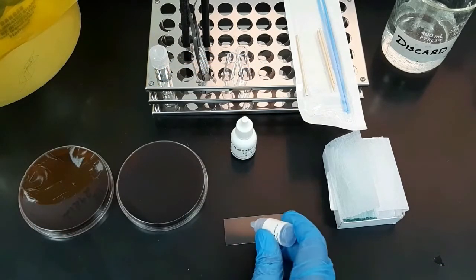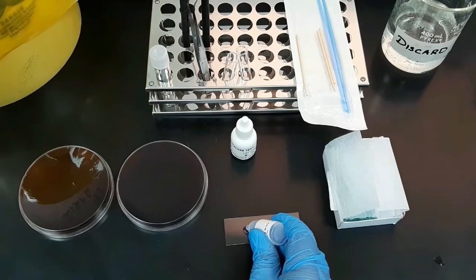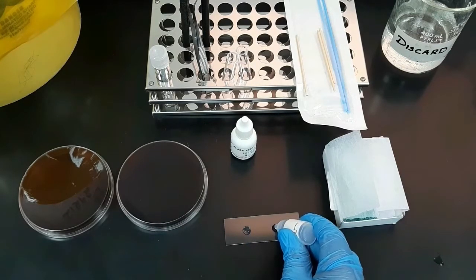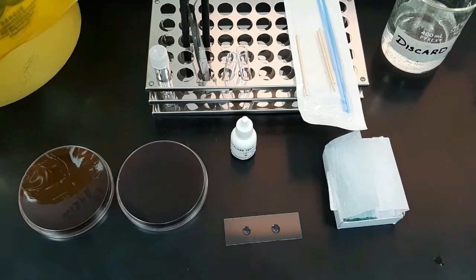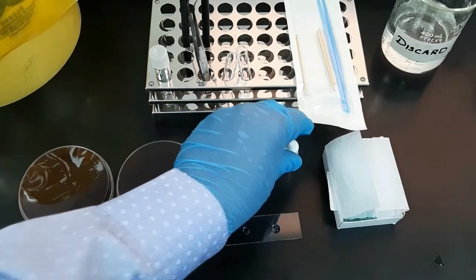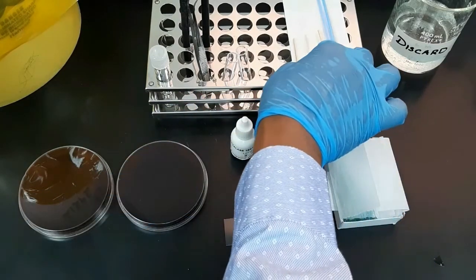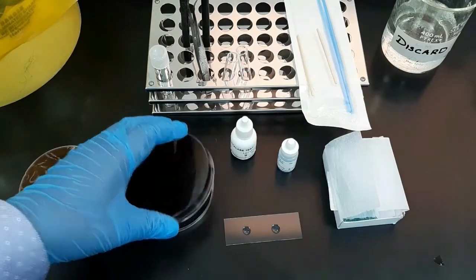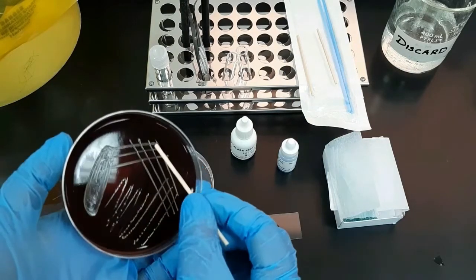Place a clean glass slide on the table. Take a bottle of hydrogen peroxide and place two separate drops on the slide — one for positive control and another one for the negative control. Using a sterile wooden stick, pick up a colony from one of the culture plates and transfer it into one of the drops.